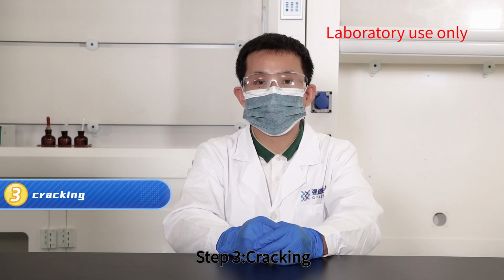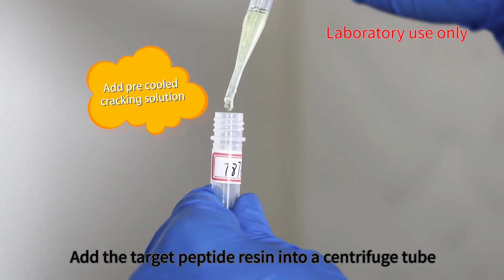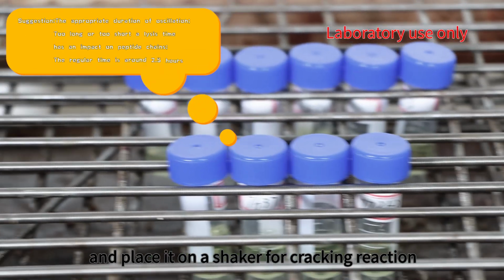Step 3. Cracking. Add the target peptide resin into a centrifuge tube. Add pre-cooled cracking solution. Tighten the lid and place it on a shaker for the cracking reaction.